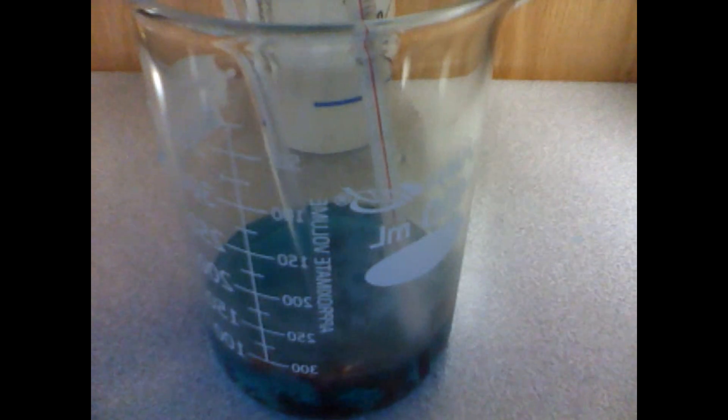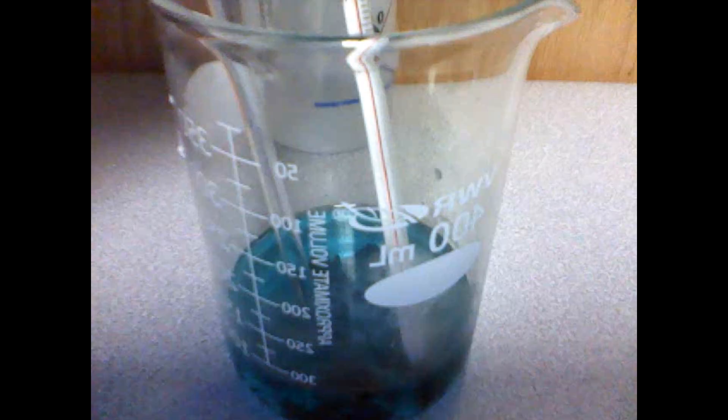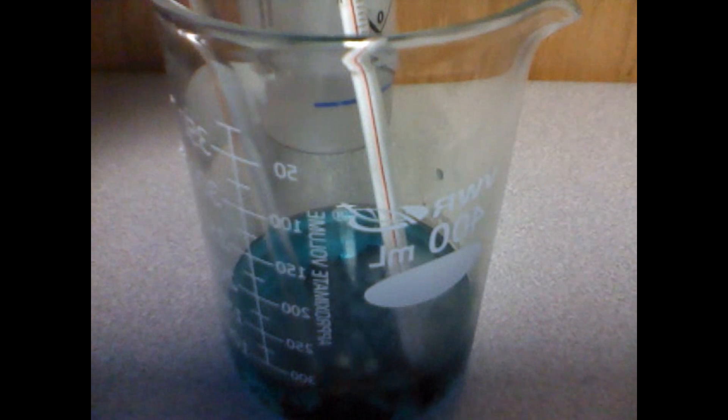As the foil is dissolving, the temperature is rising. The temperature is now 33 degrees Celsius. Temperature 34 degrees Celsius.